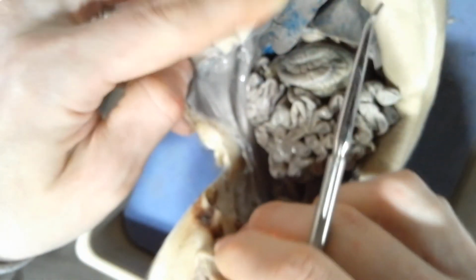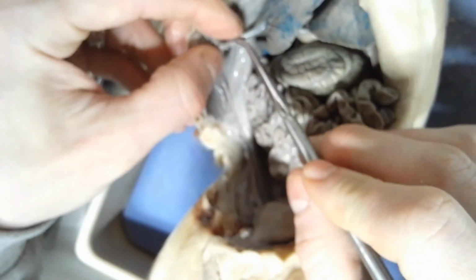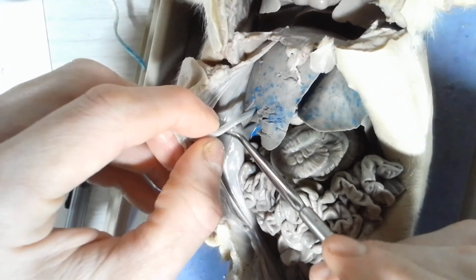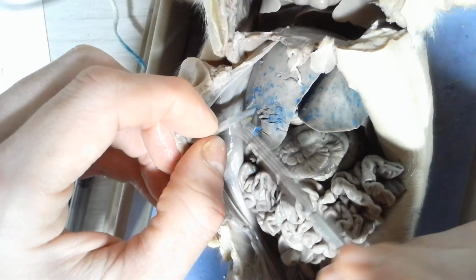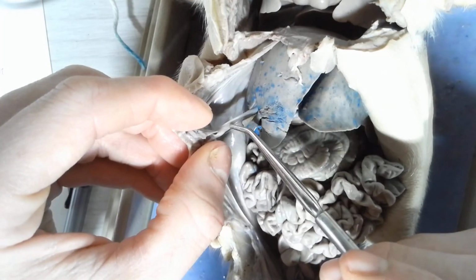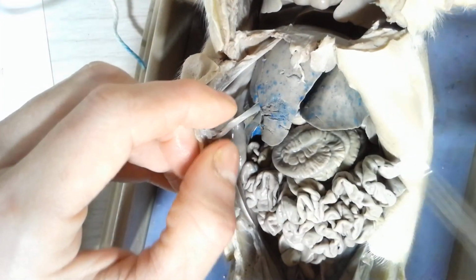Okay, now the umbilical cord, I cut it. It was up here, and one of the structures of the umbilical cord is right here. This is the umbilical vein. The umbilical vein actually attaches to the liver. So after it becomes a umbilical vein, after its job is done, that this pig is no longer a fetal pig, it becomes a ligament that goes directly to the liver. So again, this is a umbilical vein.